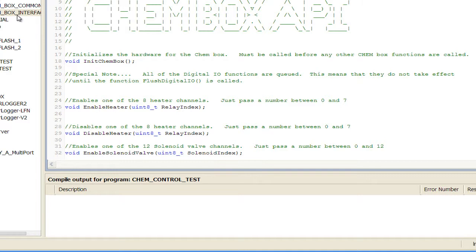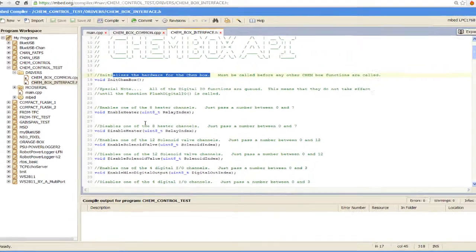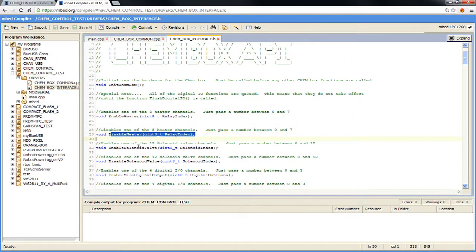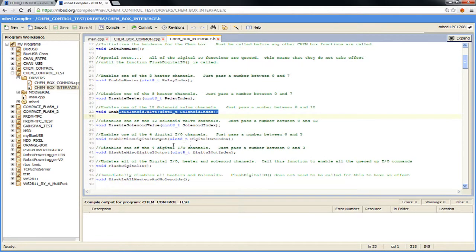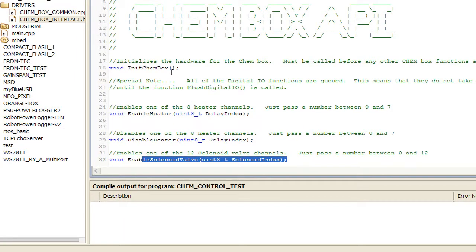The other file in the driver is the .h file, what's called a header file in C++, that has the function declarations, meaning it has all the names of all the functions in the actual driver C++ file. And if you read through this, you'll see all the function names I've given you that you can just call to make things work. For example, here's a function called initChemBox, and it says this initializes the hardware, must be called before any ChemBox program. So you can look down through here. Here's enable heater channel, disable heater channel, enable solenoid valve, and it's pretty self-explanatory as you read down through here.